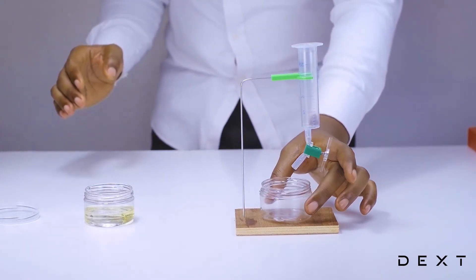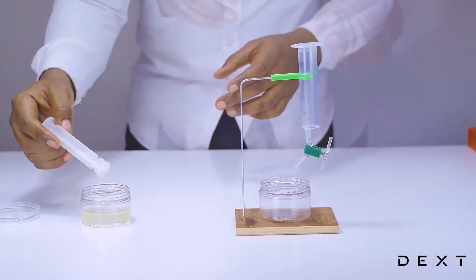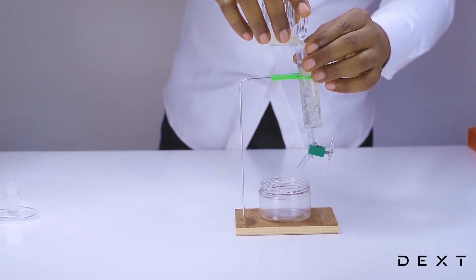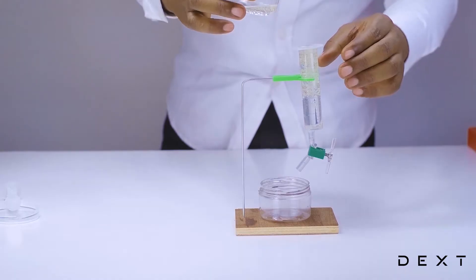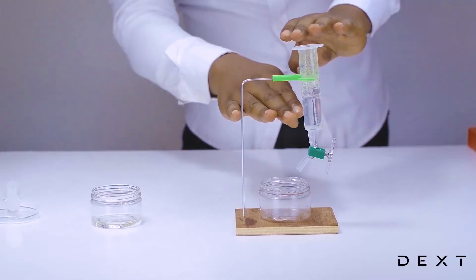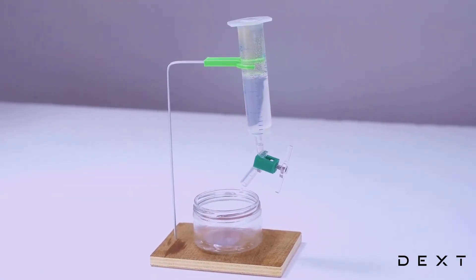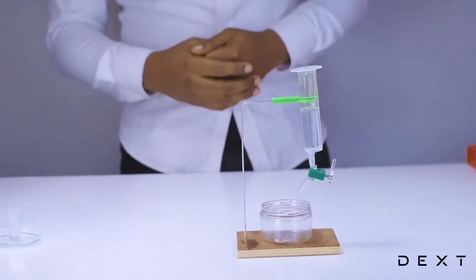And then we are going to try and mix it with our simple plastic piece. Now let's pour that gently into our separating funnel. As you can already see, the mixture has begun to separate. You have the water down there and then the oil on top. You leave this for about 15 minutes so you get a nice separation.